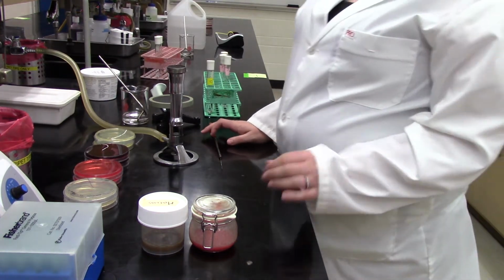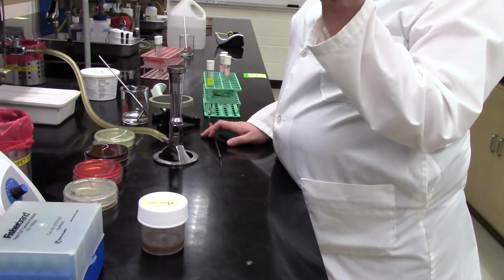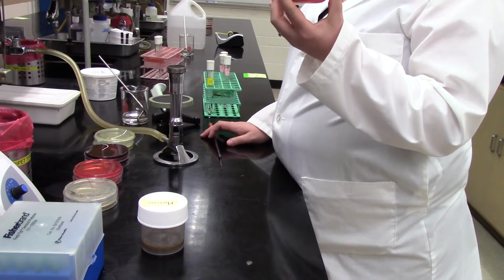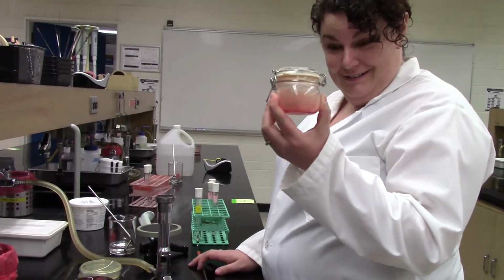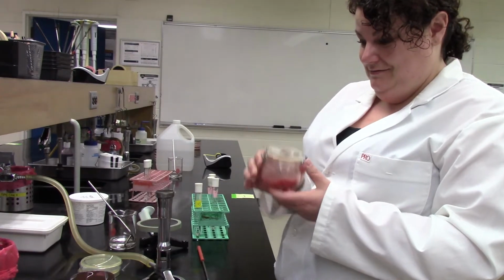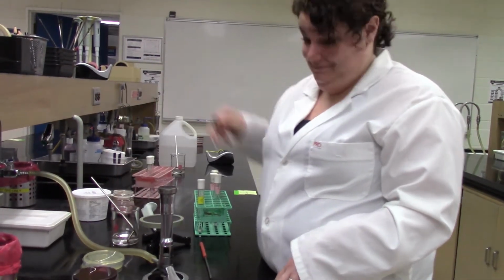We also have in that jar, the reddish liquid in there is juices from meat. I believe, was it sort of chicken or a mix, Sabrina? Chicken, vegetable, and fine bone raw dog food. Excellent. So this is being left down at room temperature to increase the chance that we'll get microbial growth, and we're pretty sure we do have that.